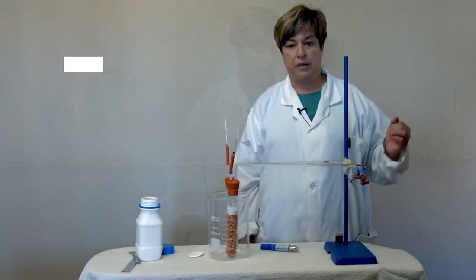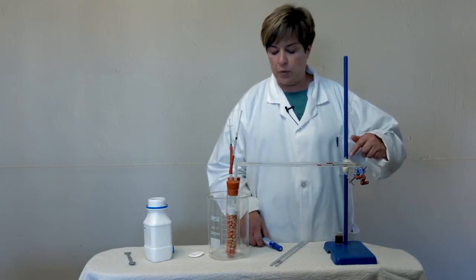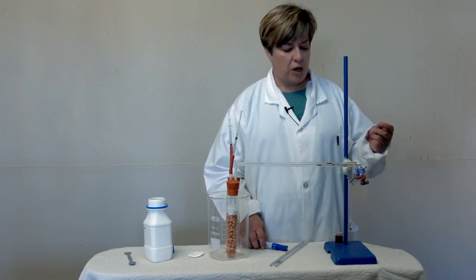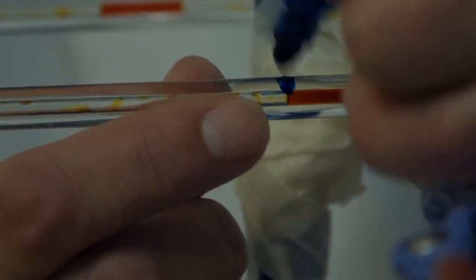So as soon as we saw movement, then what did we do? We start our timer, and you can use your cell phone timer, you can use your watch, and then every minute we made a mark. And you will see not every mark will be equally spaced, and that just depends on how the oxygen is being used. So what is happening?